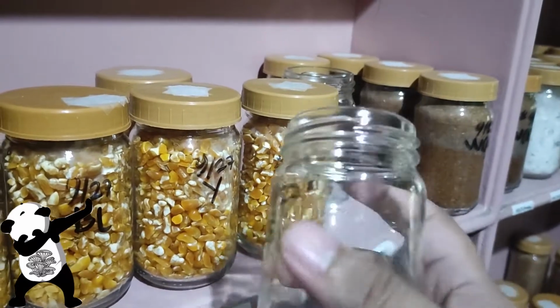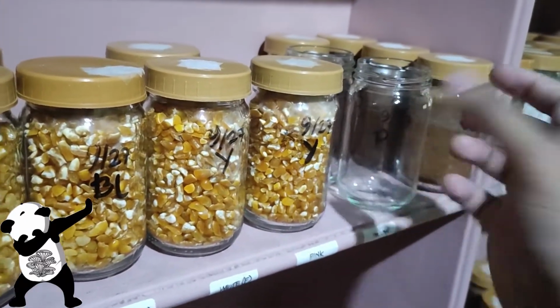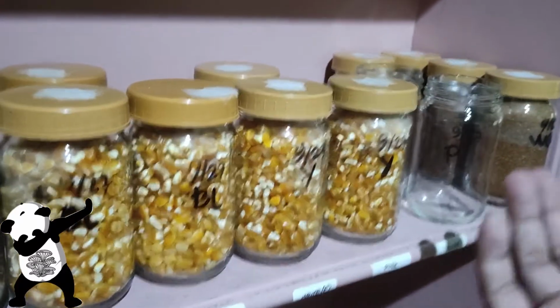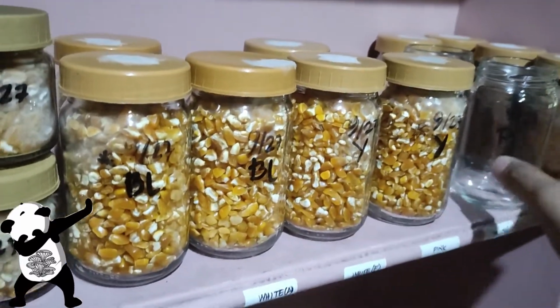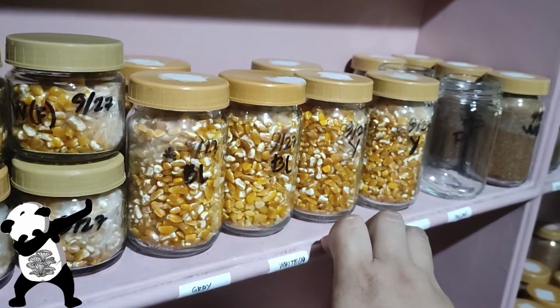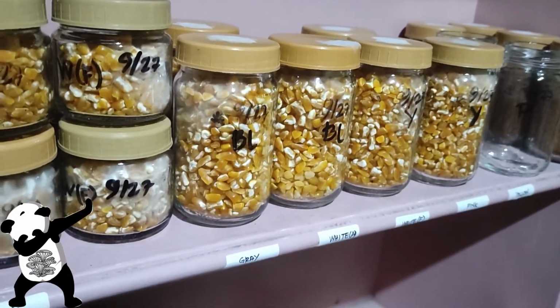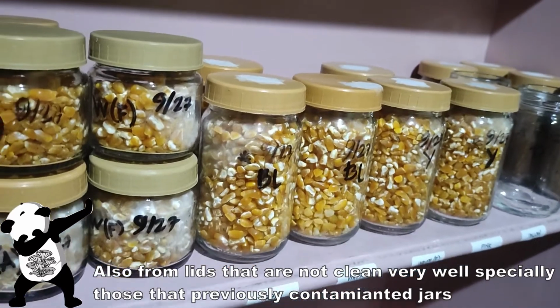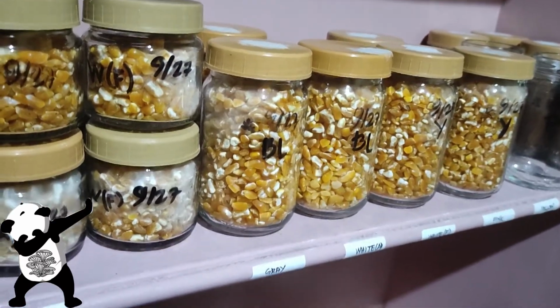These are already cleaned, and they got contaminated, and based on the looks of the contamination, it actually originates on the PDA. So it's not on the grains, it's on the PDA. With that, I would say that most of my contamination comes from my inoculation, or the PDA is not clean, even though when I see them, they actually look clean. So it's more than what you see. It depends on what you observe.